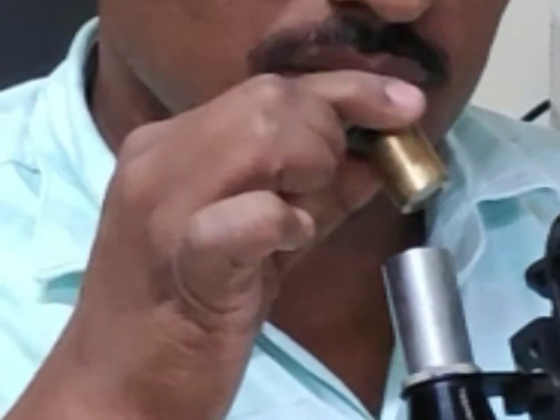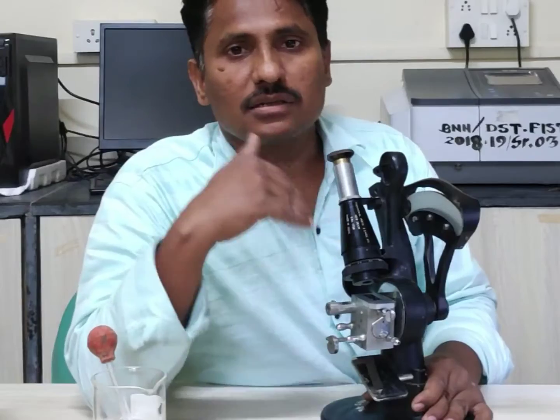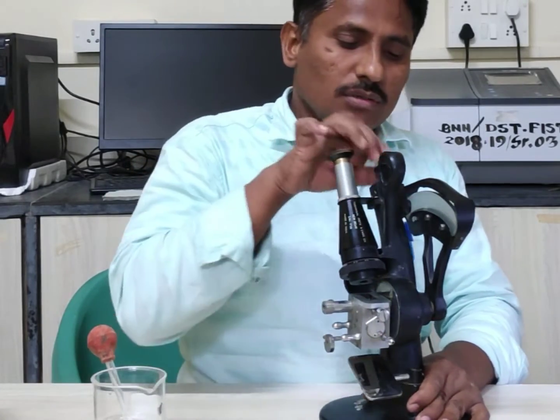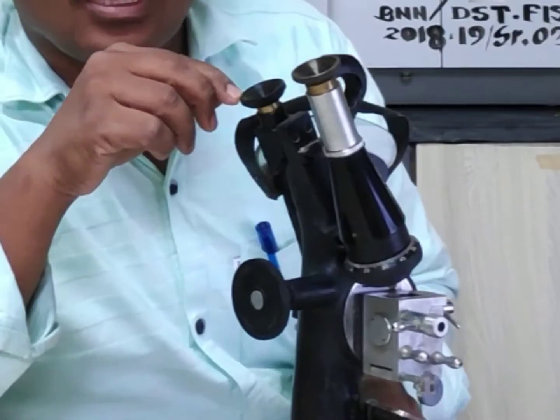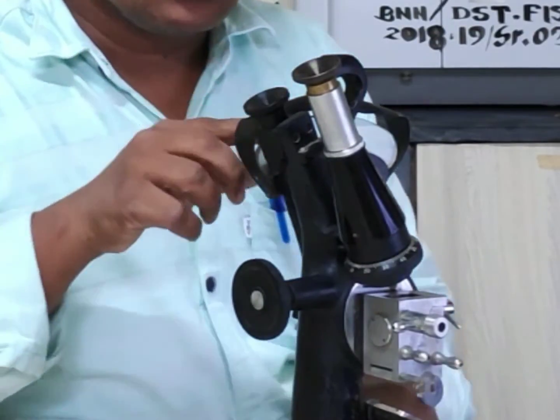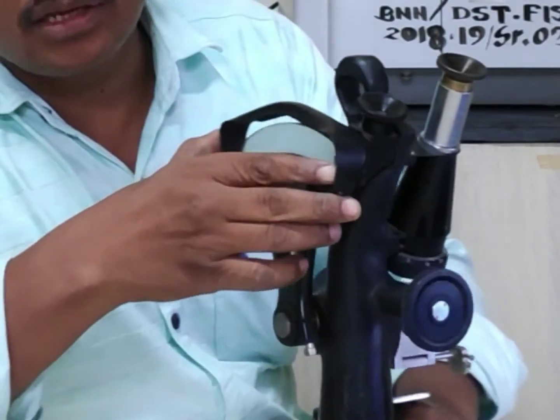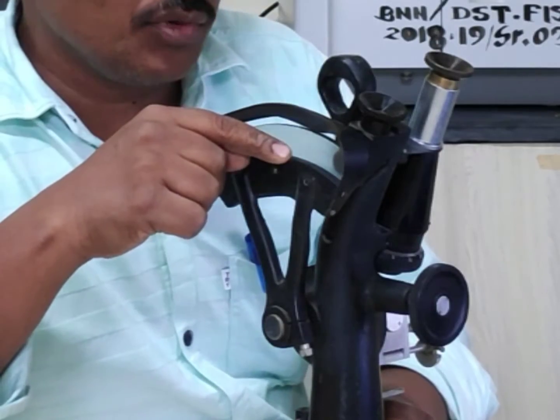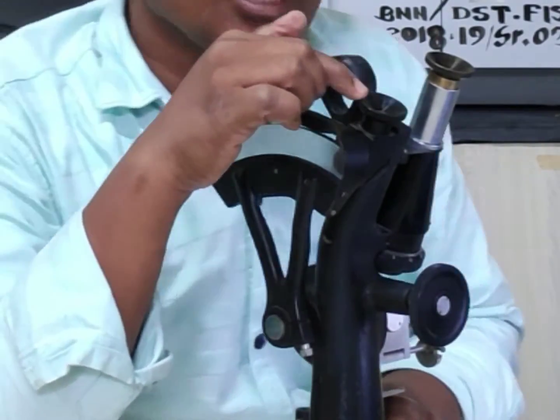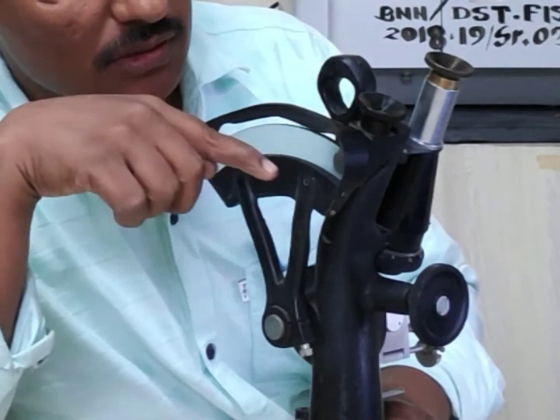This is your eyepiece, through which we can see whether the light is coming or not. There is another eyepiece used to see the scale. On the other side of this prism there is a scale, which can be observed with the help of this eyepiece.